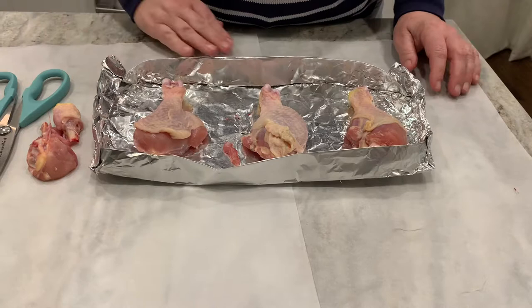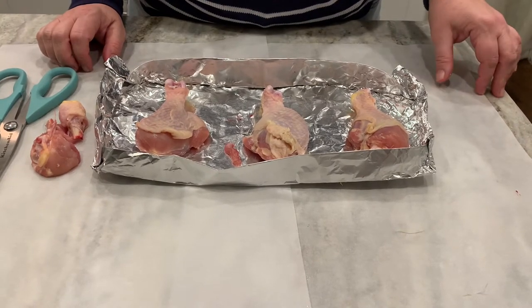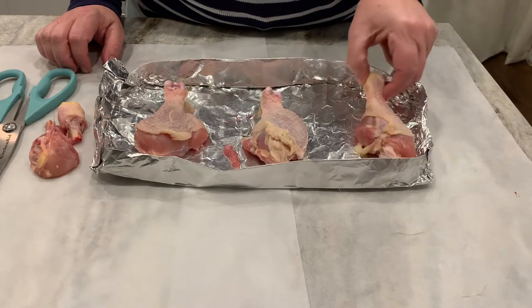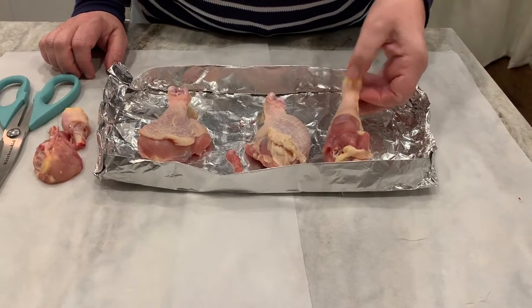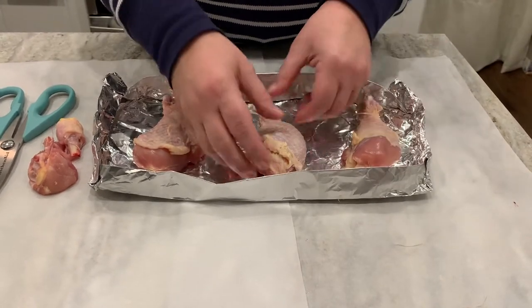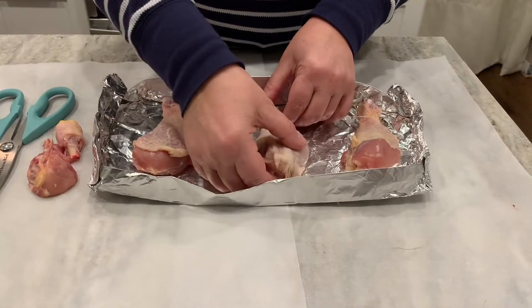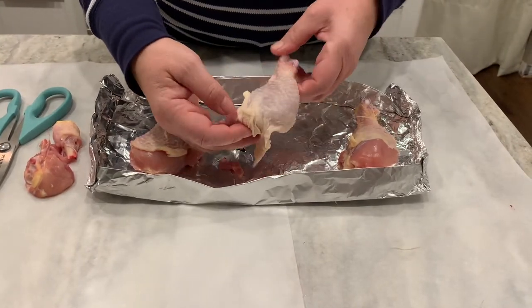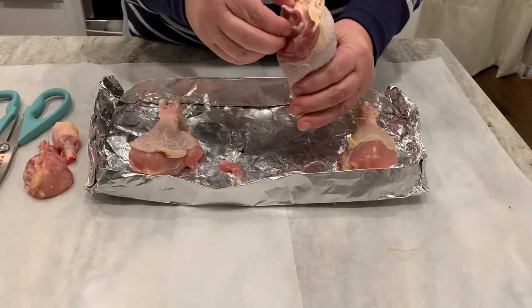We're going to look at four tissue types: epithelial tissue, nervous tissue, muscular tissue, and connective tissue. This is equivalent to looking at the lower extremity — we'll see the tibia and fibula, as well as the ankle joint and the knee joint.